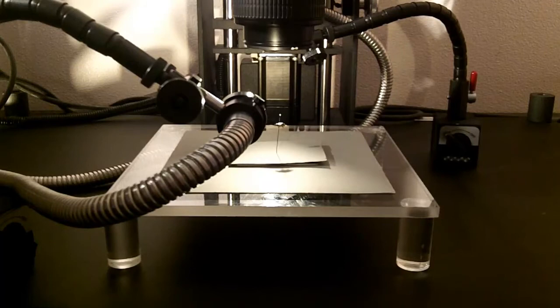So here we have the same specimen and the same lighting setup with the fiber optic cables and the overhead studio lights, but we've added the diffuser. Here you can see that those shiny spots on the side are more evened out. They're spread out a bit more. And so let's see what it looks like when we take a test shot.